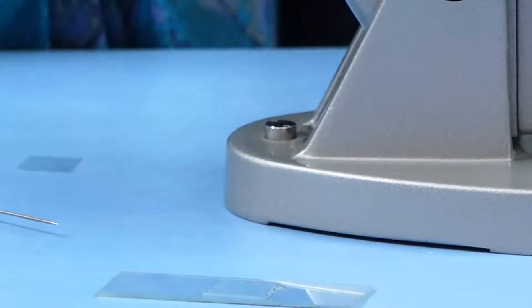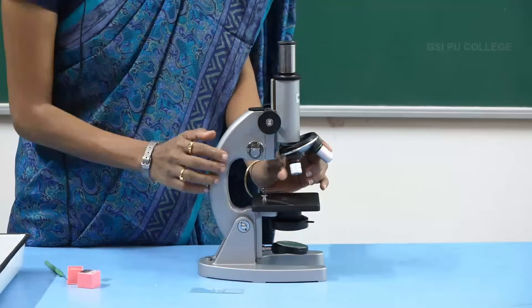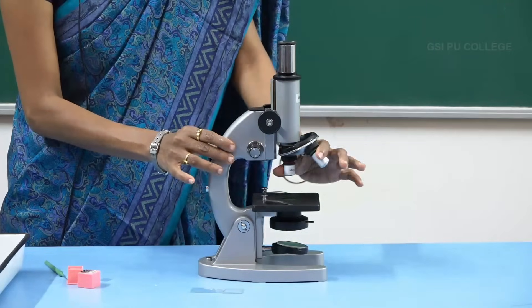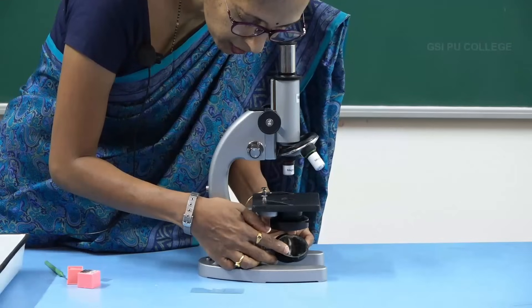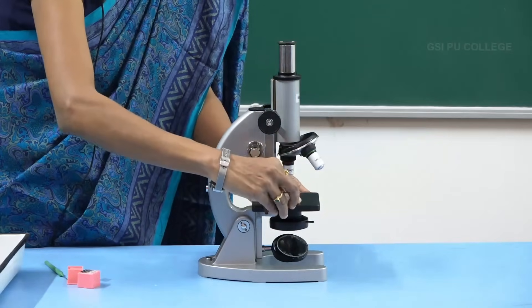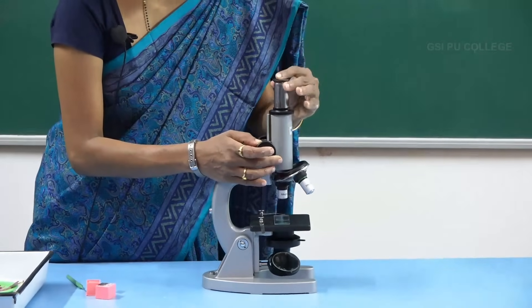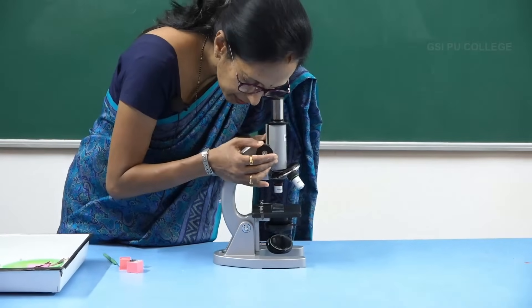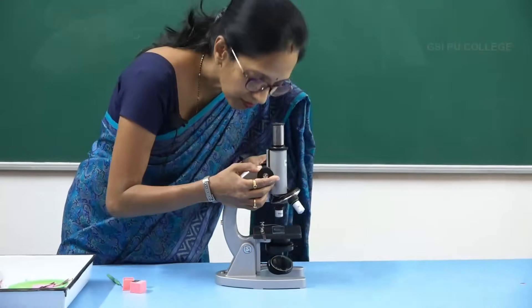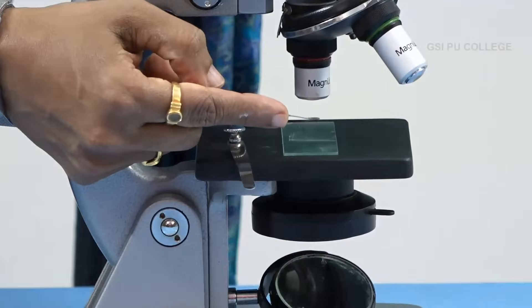So how to focus this — look here. After preparation, use the compound microscope. There are two adjustments: low power objective and high power objective. For this, low power objective is sufficient. You have to turn the mirror towards the light, then keep the slide, and by looking at the ocular or eyepiece very close to your eye, you have to focus it. Between 1 to 1.5 centimeters length, it will get focused.